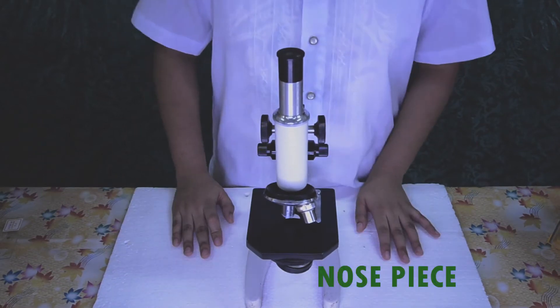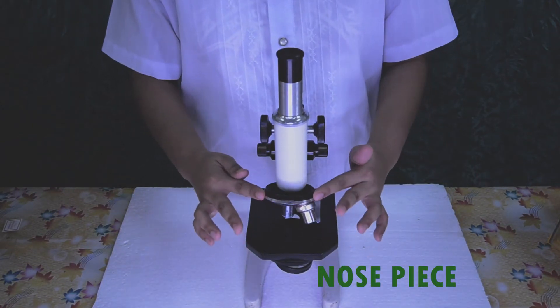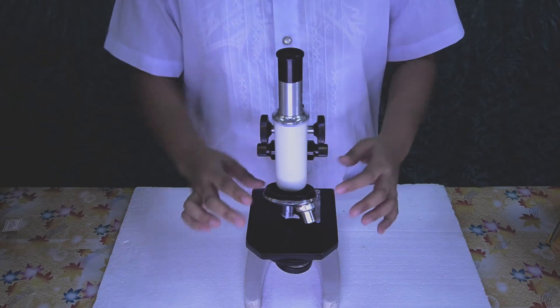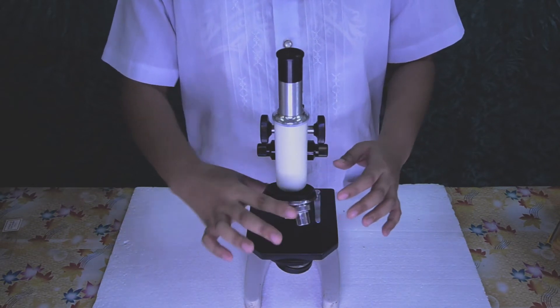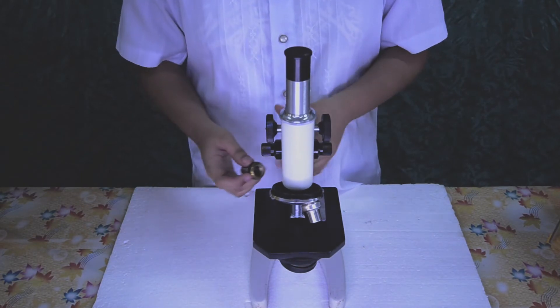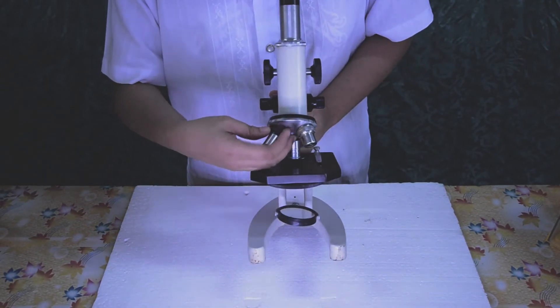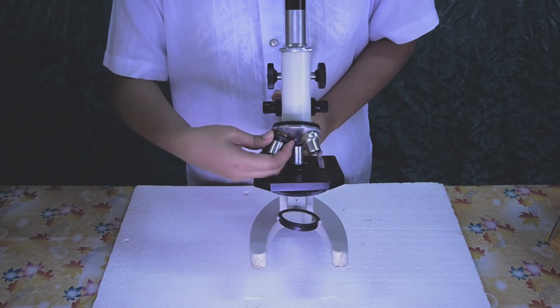Nose piece. It is a circular and revolving metallic part attached to the lower end of the body tube. It has three holes in which objective lenses can be fitted.